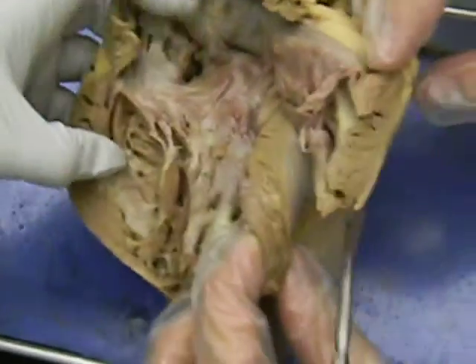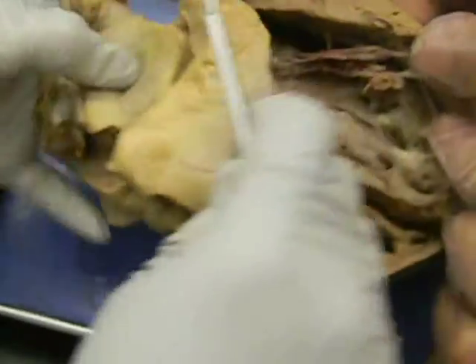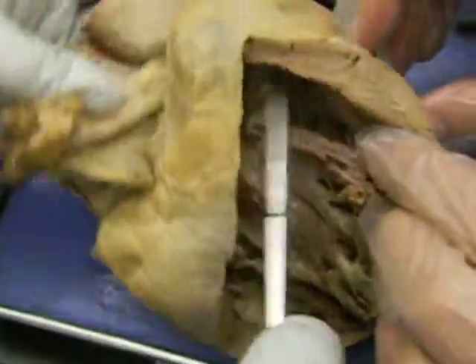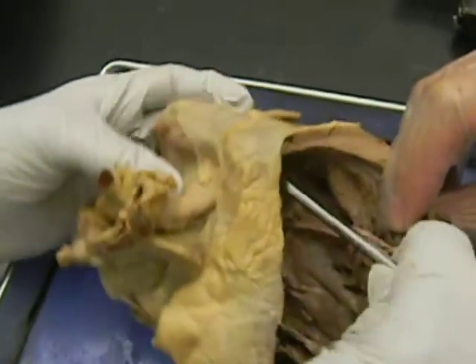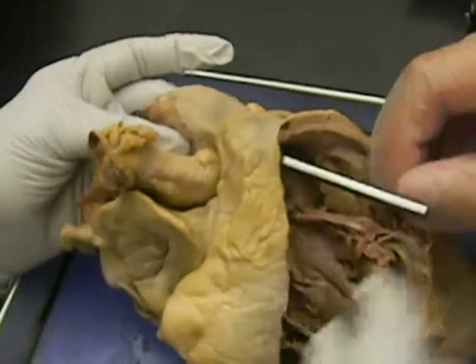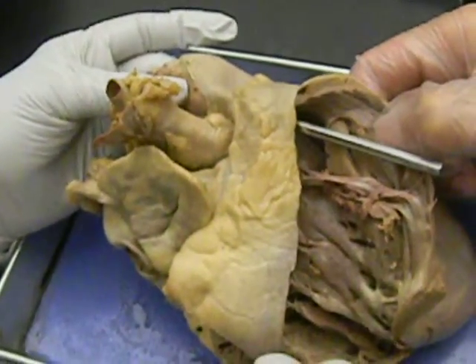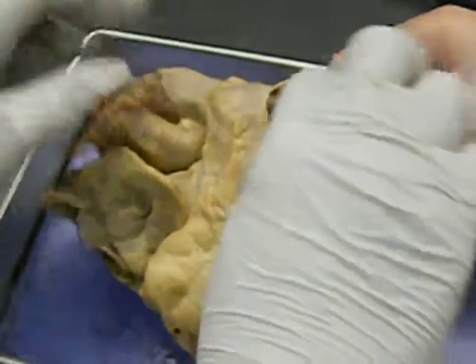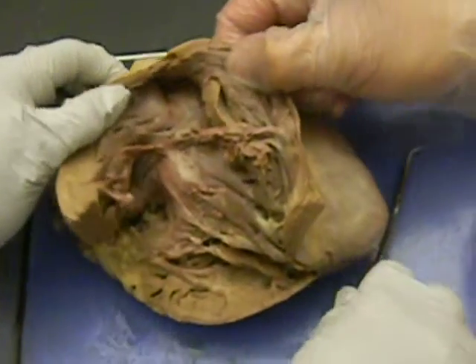Okay, now we go to the pulmonary, and here they open up. If this probe is inserted like that and it says vessel, then pulmonary trunk. Okay, but if the question is tissue, because that is where, may I borrow a scalpel?